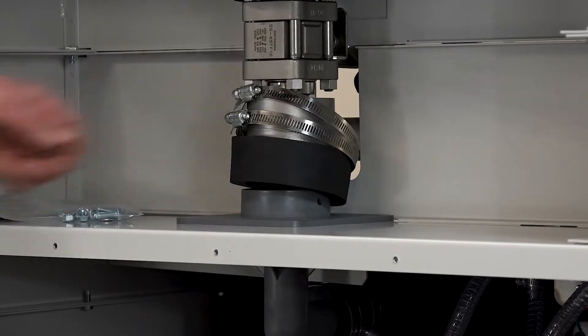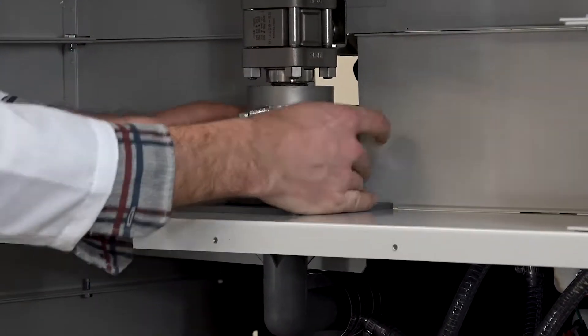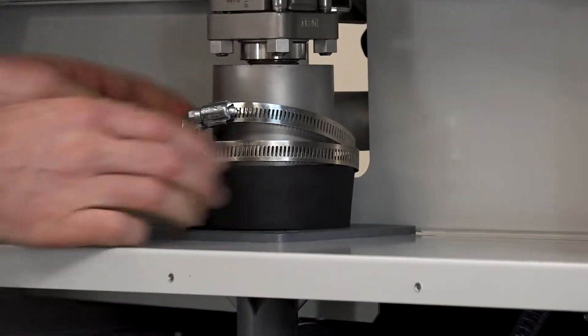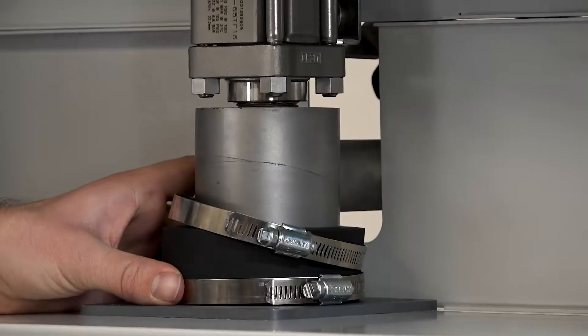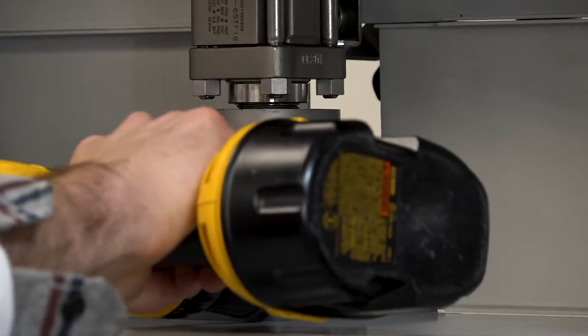Loosen the clamps and slide the lower rubber coupling down over the vacuum connection port. Orient the clamps to gain access to the screw head and tighten the clamps.